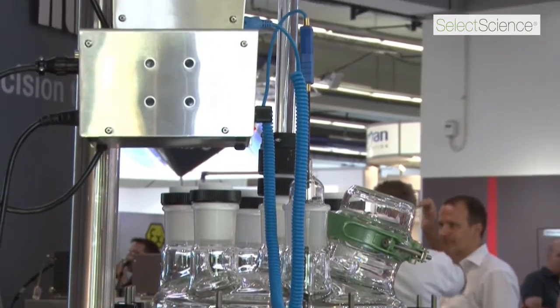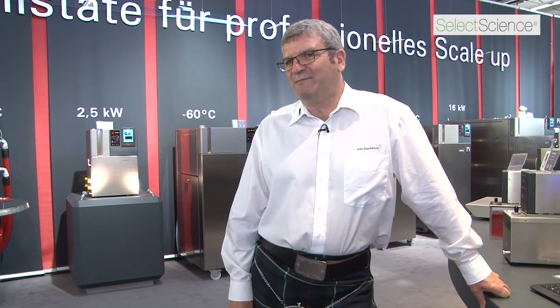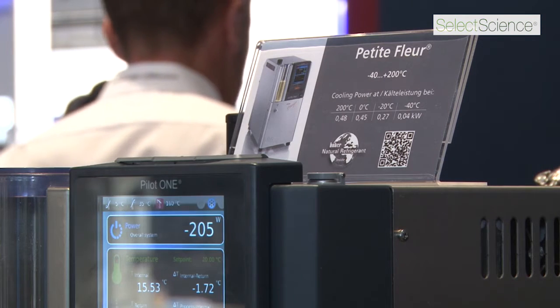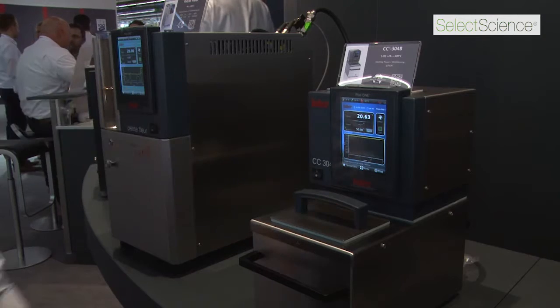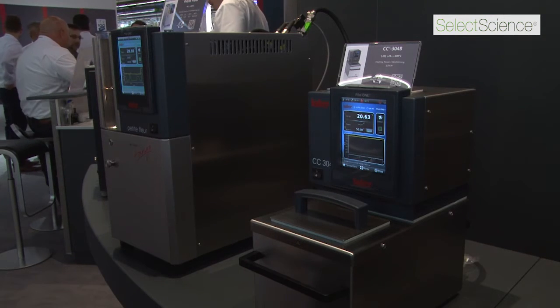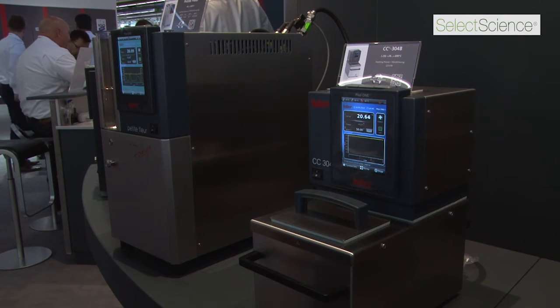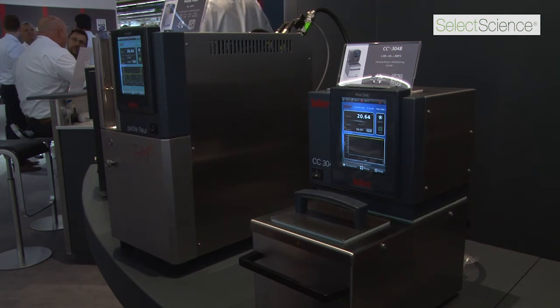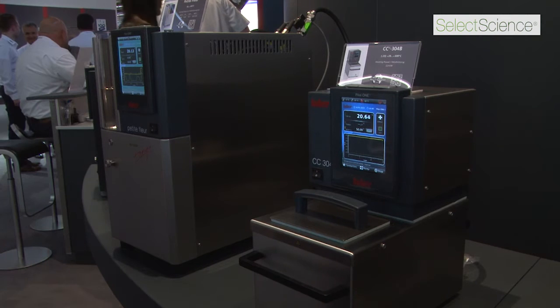The name of the software is Explore. We've called it Explore because it helps the chemist explore his chemistry. To demonstrate the Explore software, we're simulating a reactor using another thermostat. The reason we're doing that is so that we can adjust the heating value to simulate an exothermic reaction.